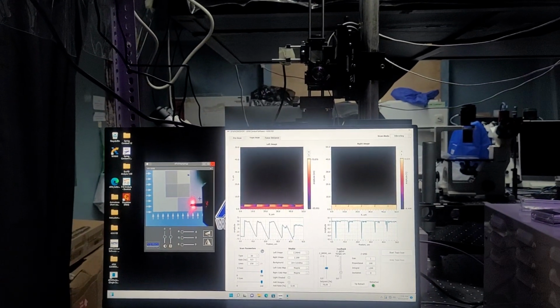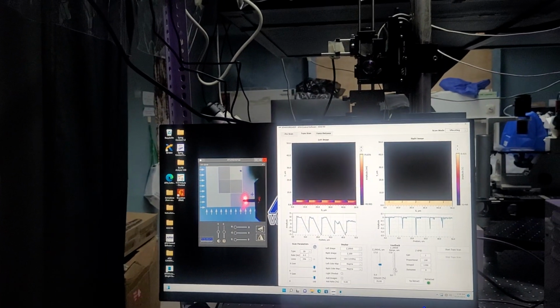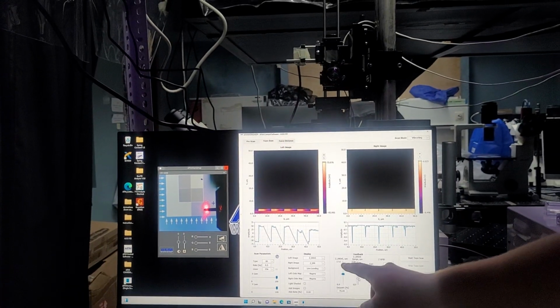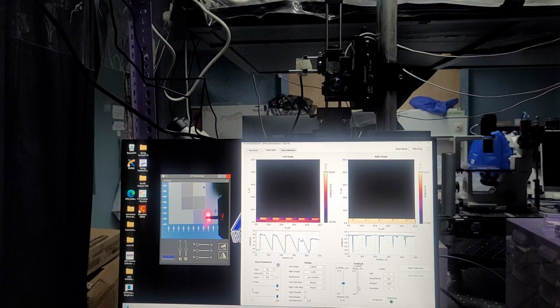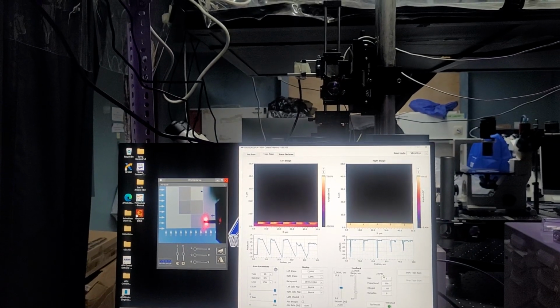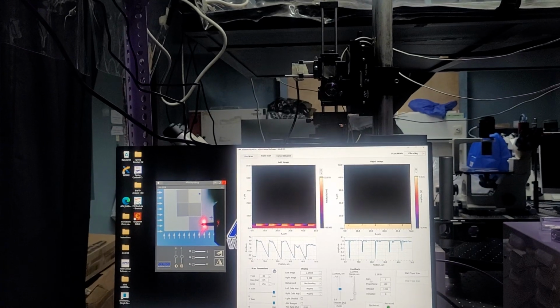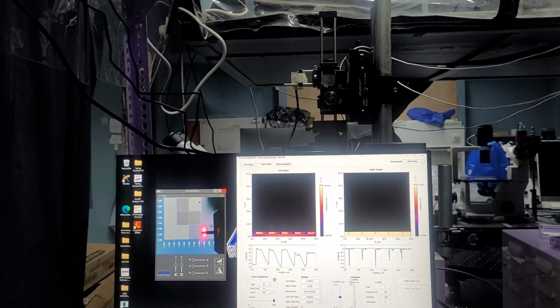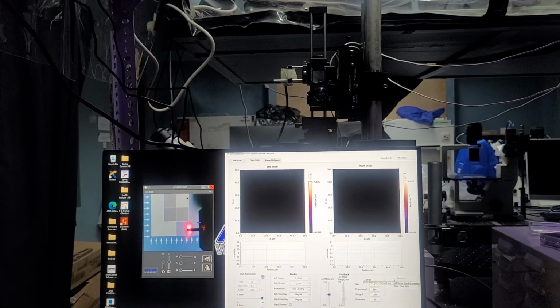The Z drive range, you can ignore this. Typically this updates every time you start the software, so in this case it was likely that whenever I started it before, the blue indicator was down there. And then the Z PID will cover this once it actually starts scanning, but this is the gain, proportional, integral, and derivative values that you'll use to minimize your error. So, with that, I'm going to go ahead and start scanning.